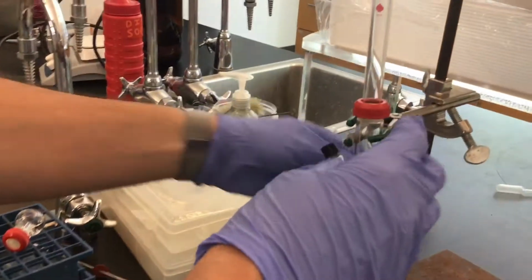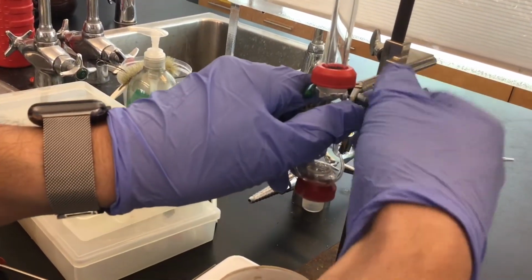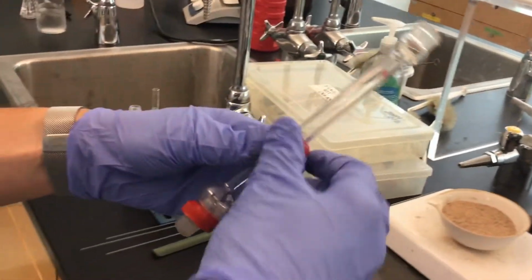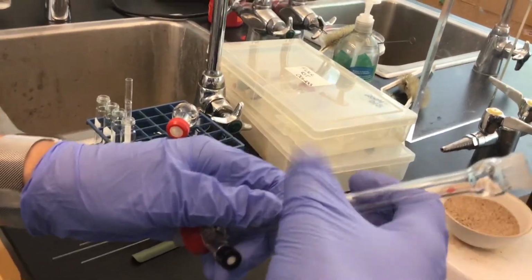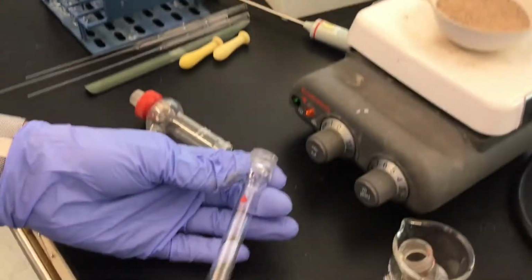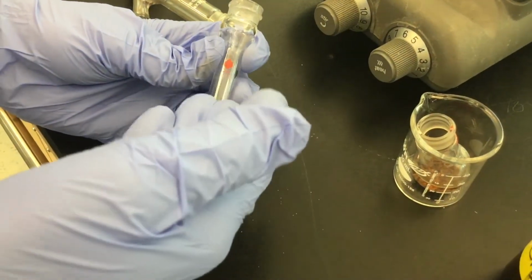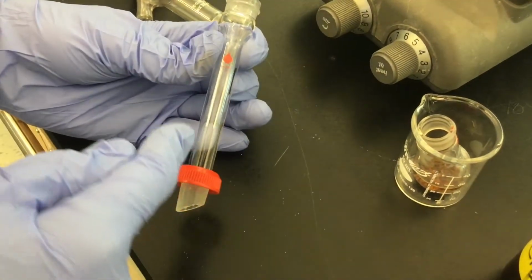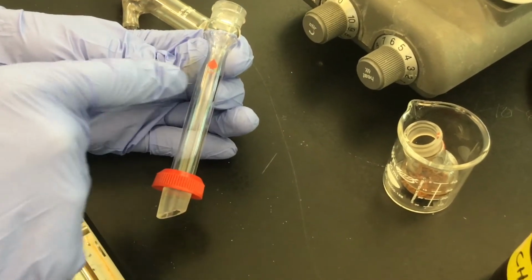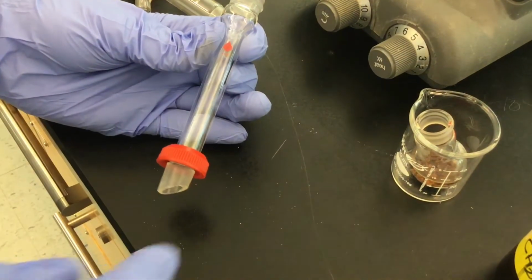The rest of the setup we can see is already connected to the ring stand, and I'll explain what's going on with these individual pieces. The one that I'm going to show you now, this one here, is called an air condenser. It's called an air condenser because it's being cooled by the air in the laboratory, and any steam that might eventually travel up the vapor, the steam itself will condense and then come back down.